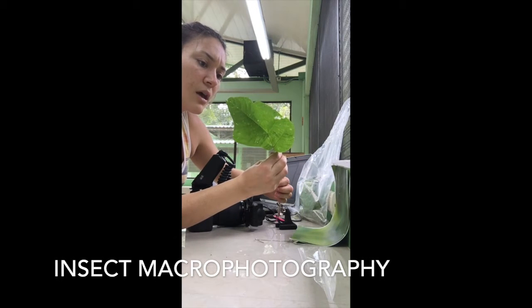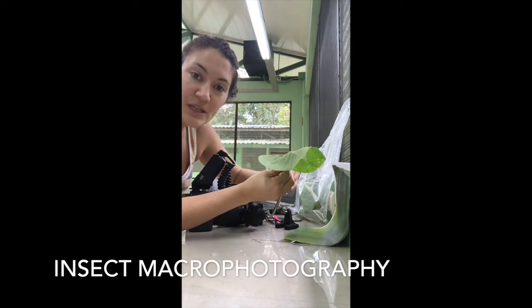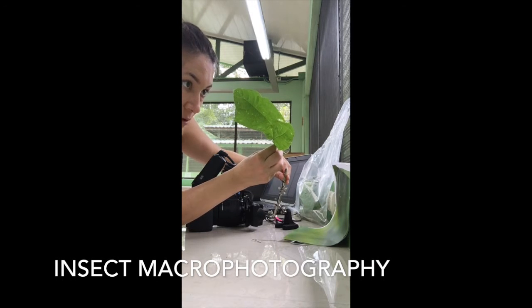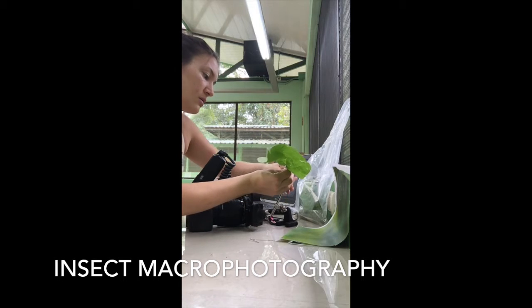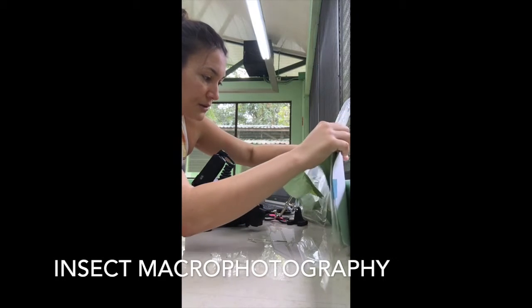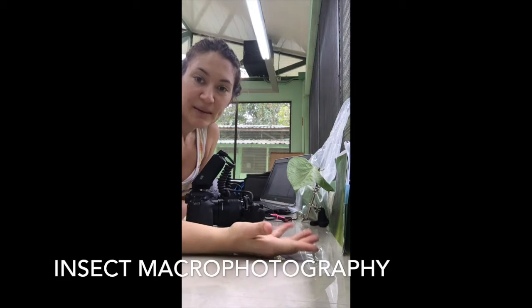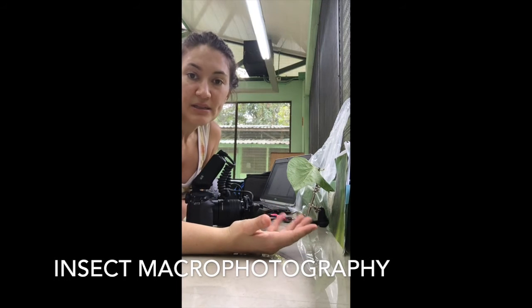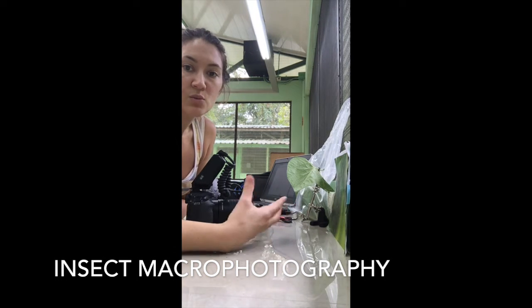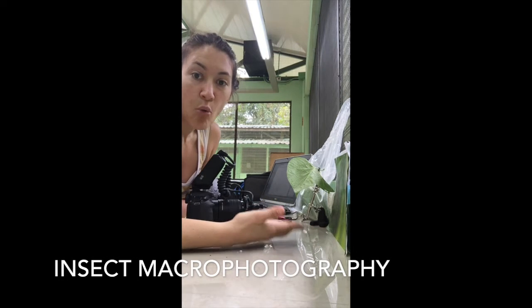So it doesn't look to me like he has any bruising on it, so it most likely is not parasitized, but you never know. So this may simply be a record of an interaction rather than yield any parasitism data. But in order to get parasitism data, we need to know, for example, parasitism rates. We need to know how many individuals we've collected, how many of those were parasitized, and how many were not. So even though he doesn't have a parasitoid, he's important data.